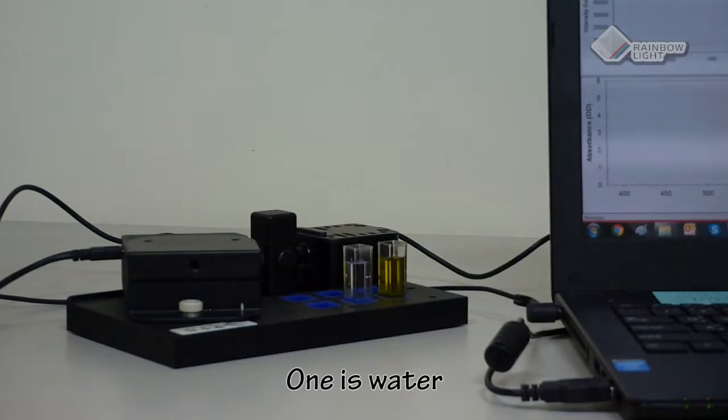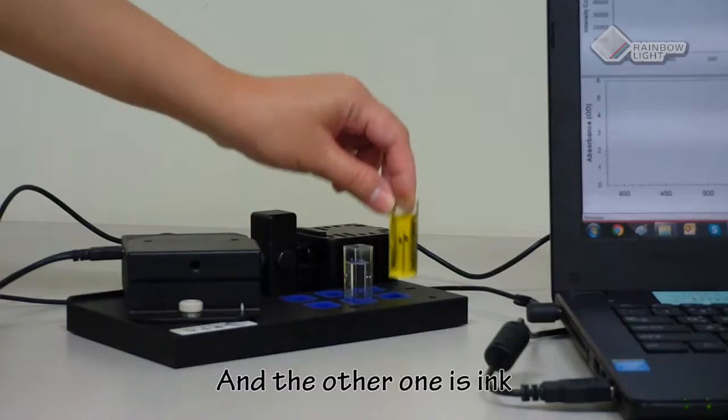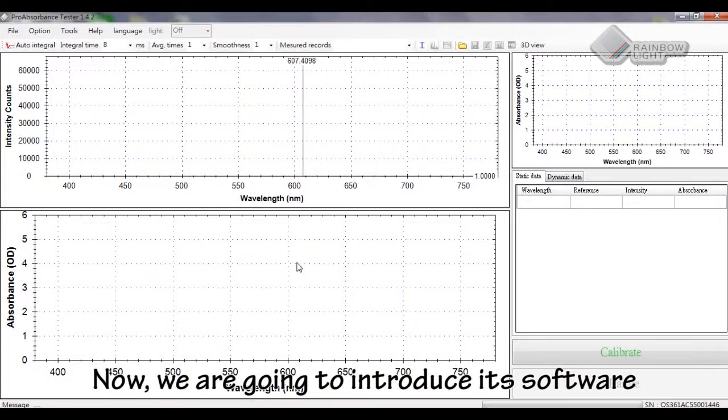Today we prepared two different liquid materials. One is water, which is for reference. And the other one is ink, which is our object sample today.